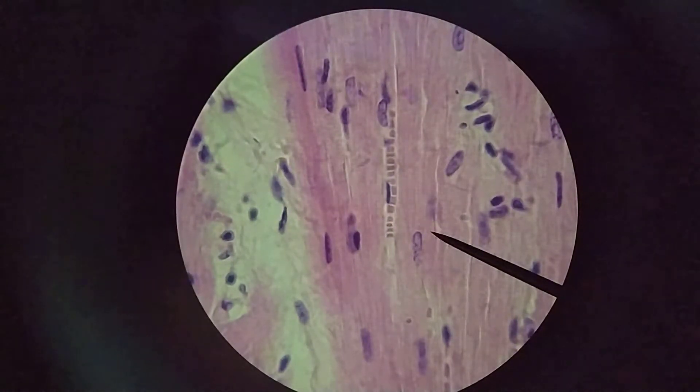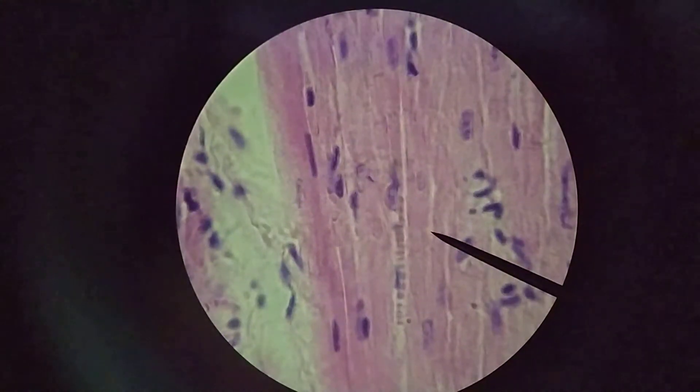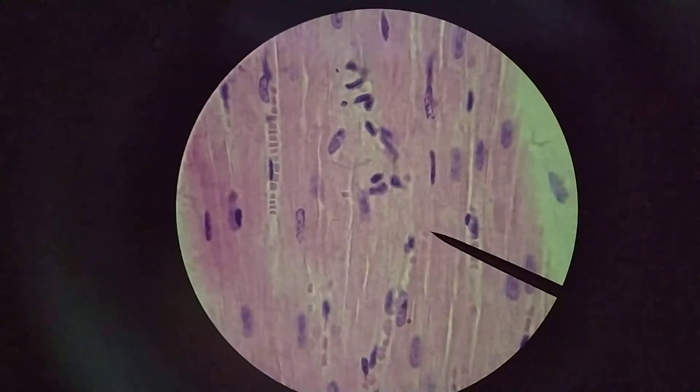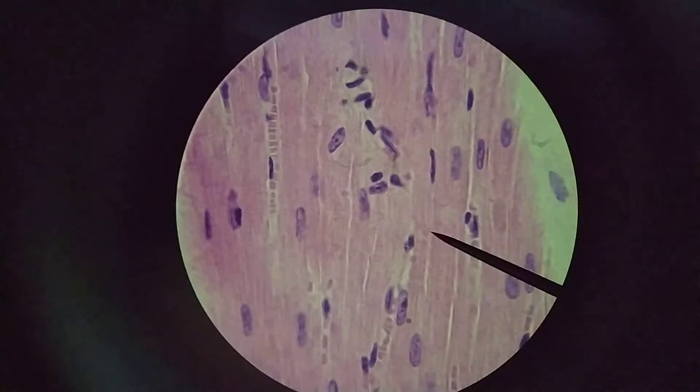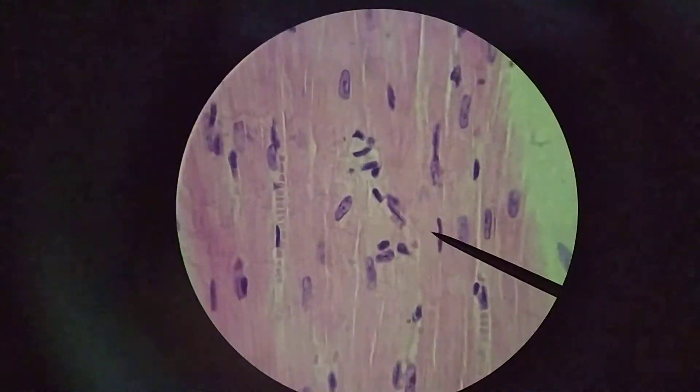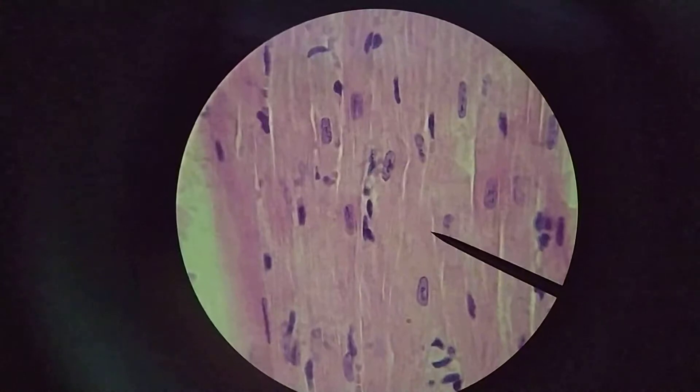Let's see if we can find any branch points in some of these cells. It's a little difficult to see some things at very high magnification because of depth of field. Lots of capillaries are visible here. We have some branch points visible just up here — two cells with two nuclei connecting right here. Unfortunately we don't really see the intercalated disc here — I'm having a hard time getting good contrast on this slide.